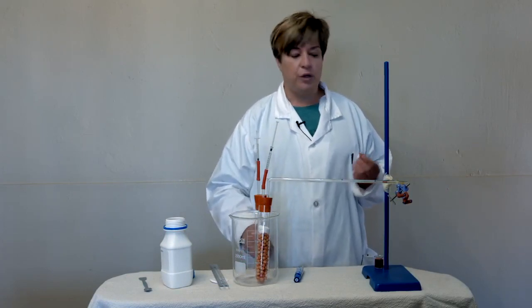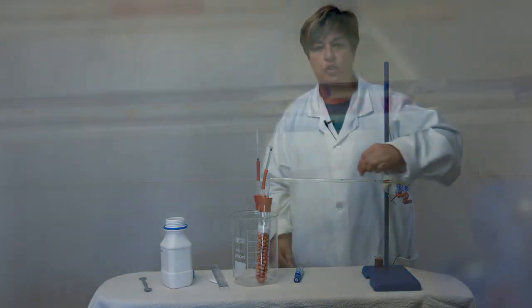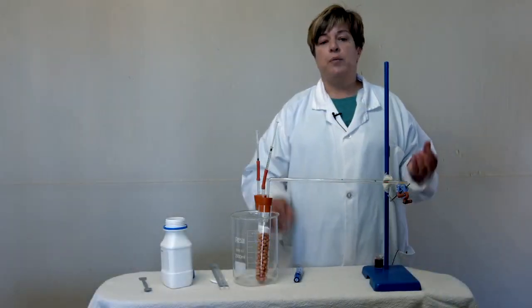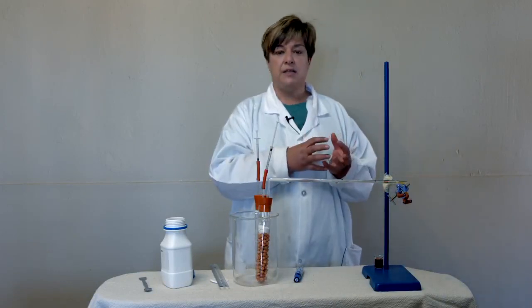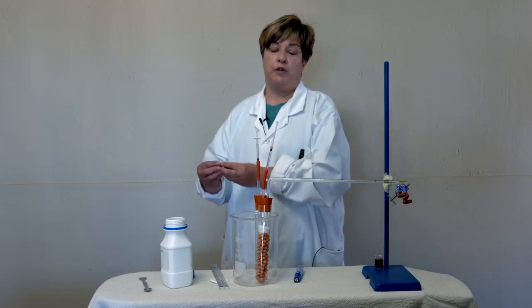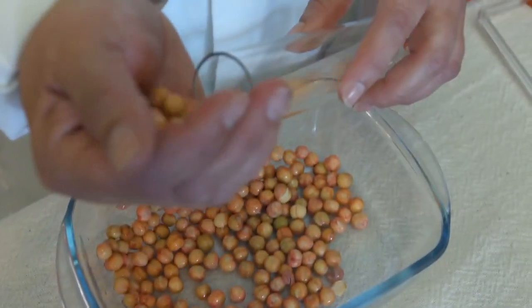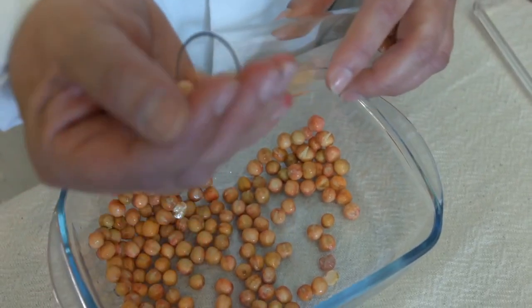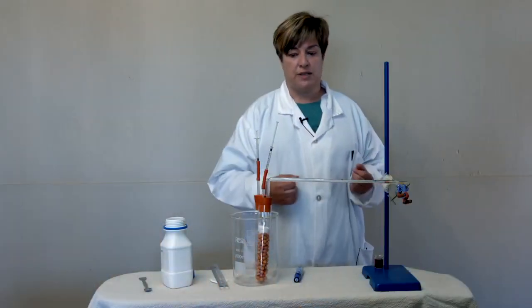Why do we say volume? Because it is in a tube, it is in a cylinder that is being used by these pea seeds per gram fresh weight. Why per gram fresh weight? Because if we have 10 seeds, they will take up a lot more oxygen than if we have 2 seeds. Now, instead of counting all those seeds, we will be weighing them, and we know how many grams of seeds we have.